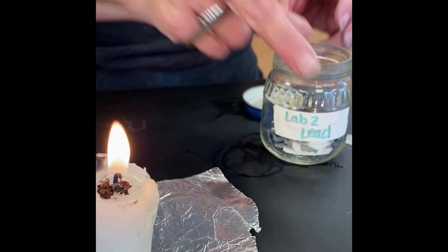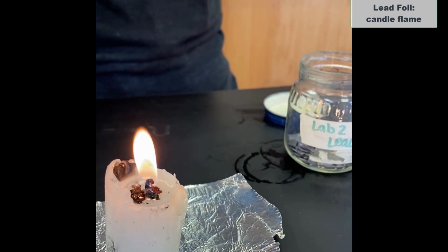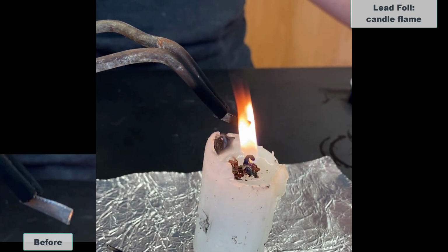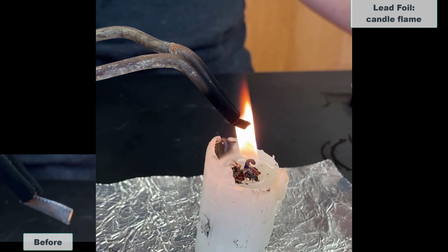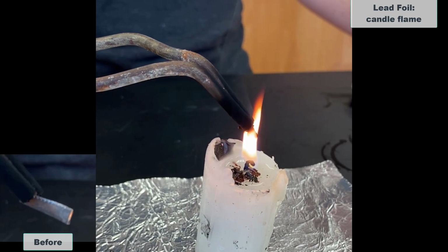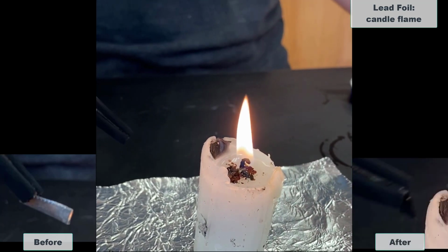And this is lead. Looks like a foil, only it's thicker than the original 2, the tin and the aluminum. So there's what our lead looks like. Oh, I got a drop that time. Okay, part of it dropped off.